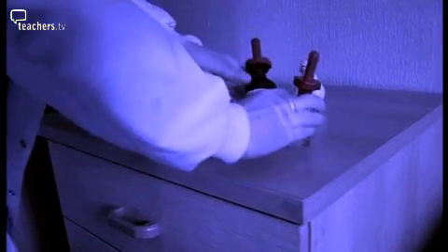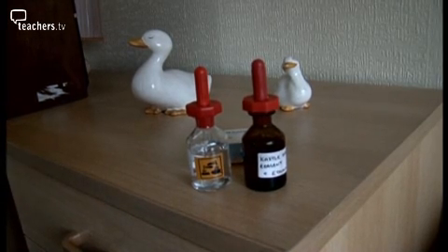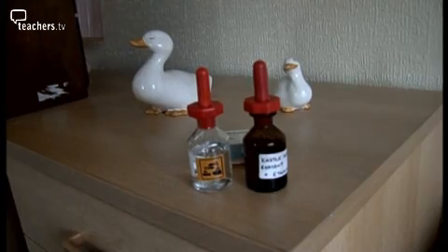Underneath the carpet there was a large area of blood staining, about 1/2 metre by 1 metre in size. We would still use the screening techniques because it's further confirmation that yes, that red-brown staining is blood. The chemical screening test that we use for blood is called Kastle Meyer. In forensic science, Kastle Meyer is used on a daily basis, both in the lab and at the crime scene. There's Kastle Meyer itself, which is actually something called phenolphthalein, and another chemical is hydrogen peroxide.